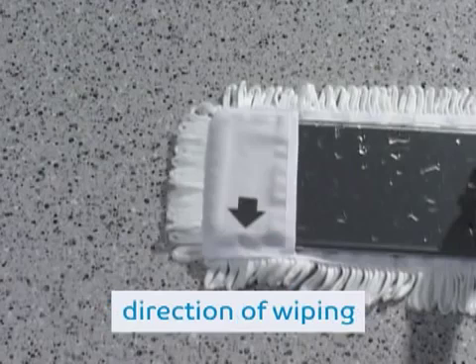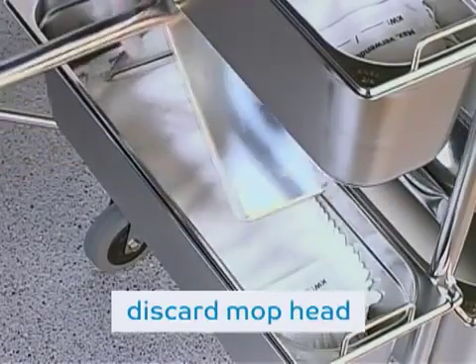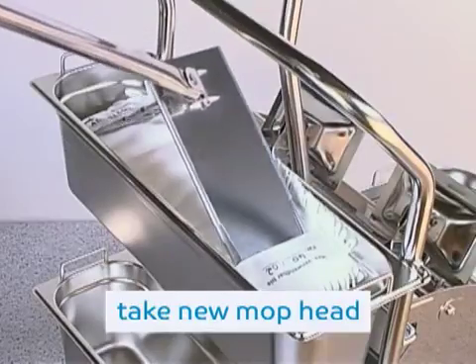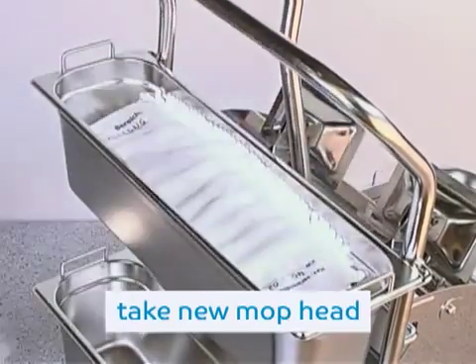The wipe direction is indicated on the mop. Place the used mop head in the lower bucket in order to change the mop head, and then take a new mop head from the upper bucket. Now you are ready to continue.